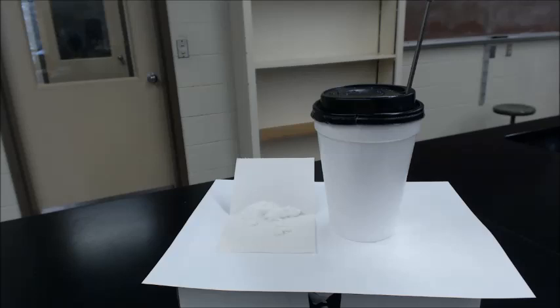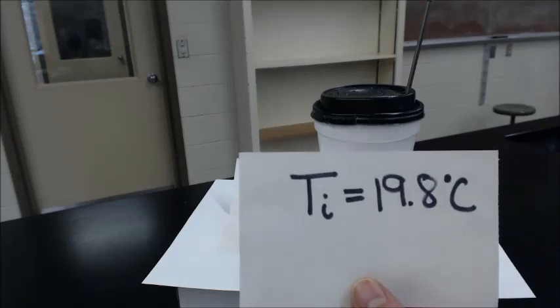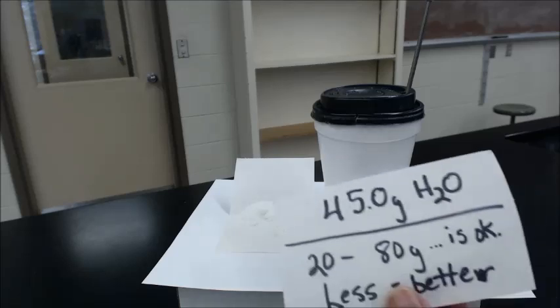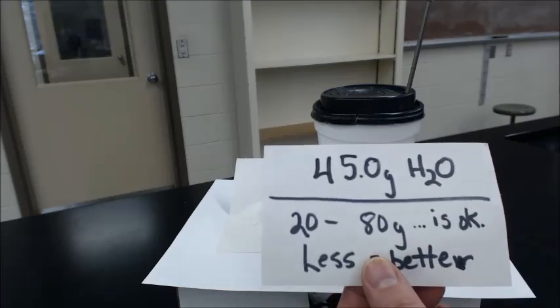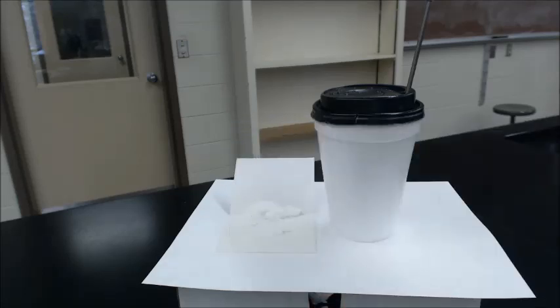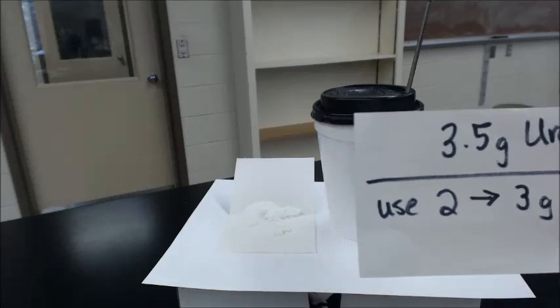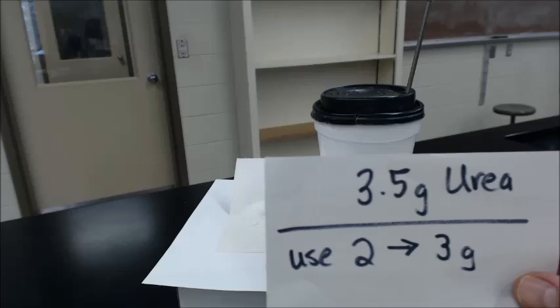Now, in order to get the temperature change, we've got an initial temperature of 19.8 degrees Celsius. I am using 45 grams of water. Less is better though, so this is okay. And I've got 3.5 grams of urea, a nice white powder on the side.